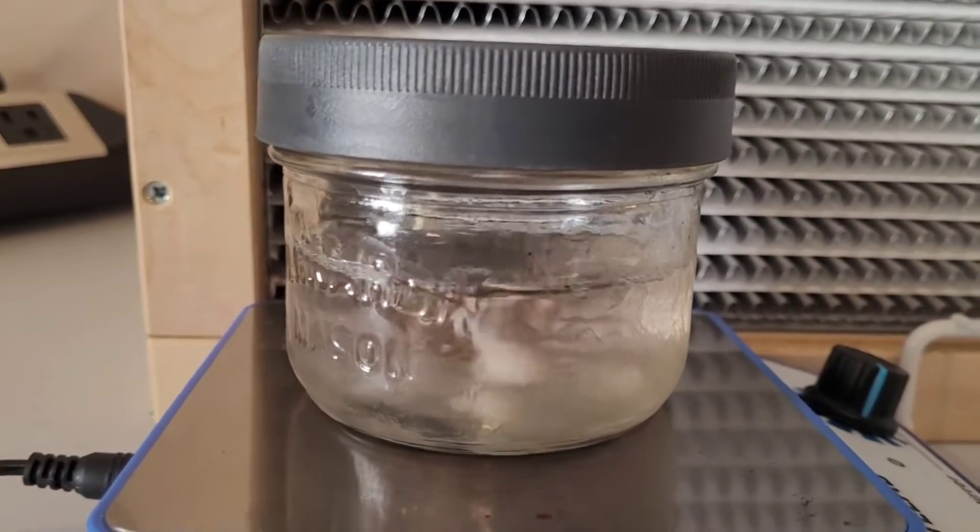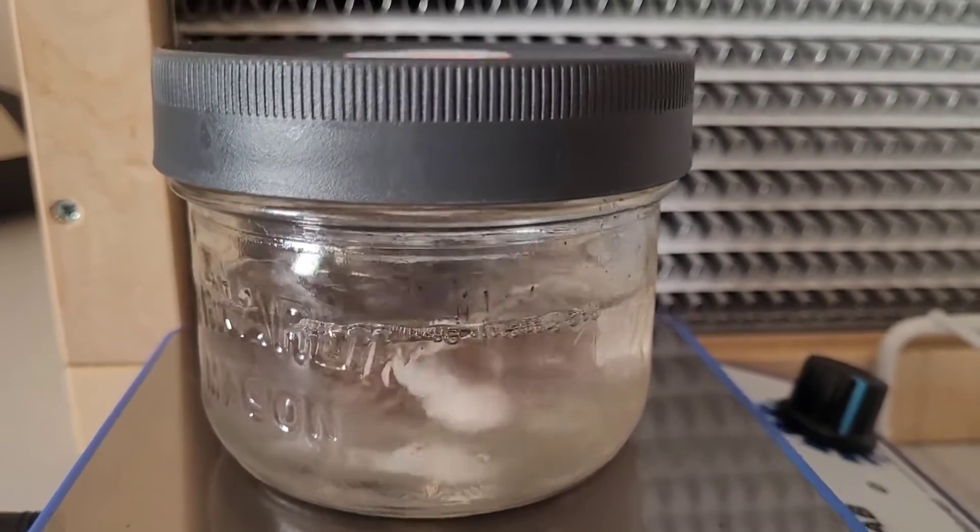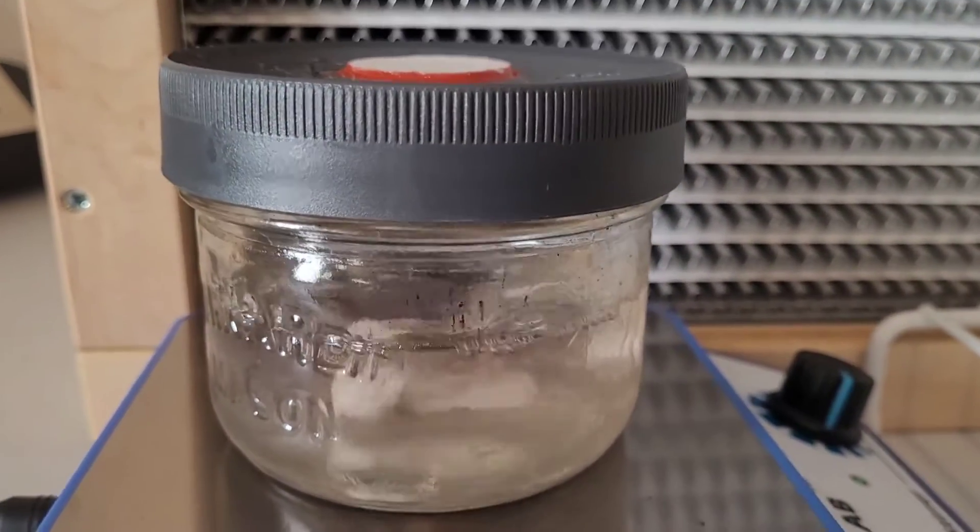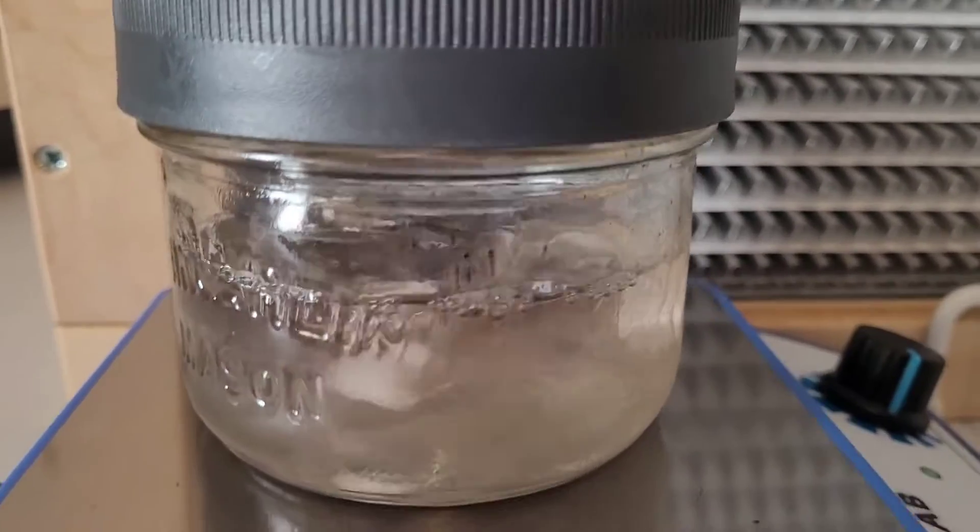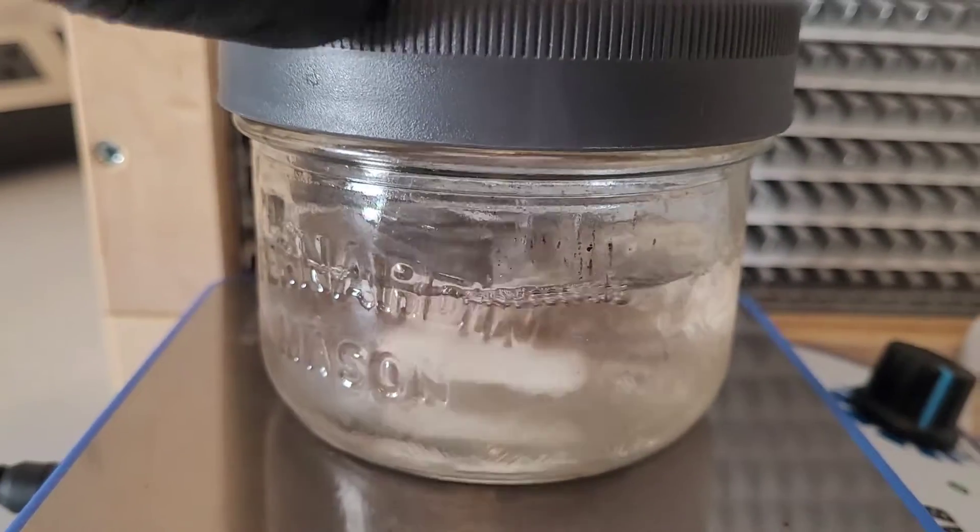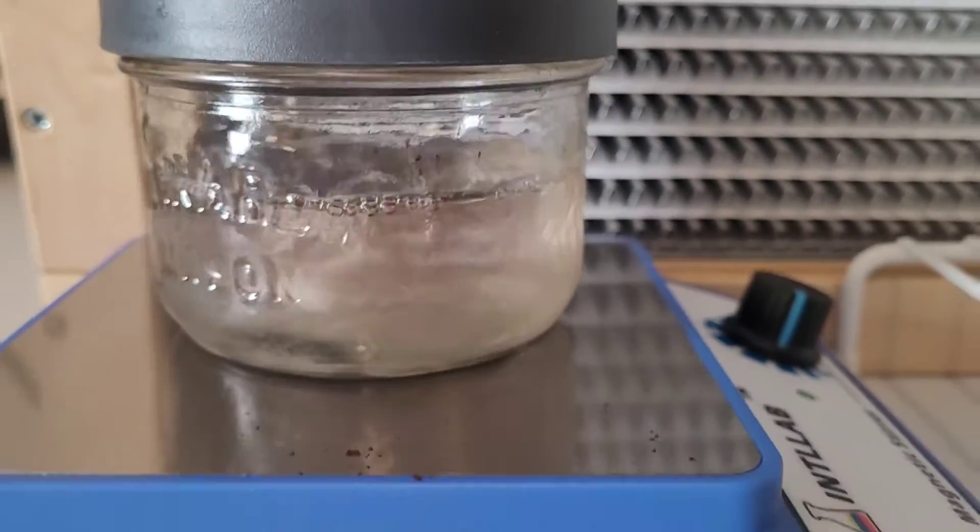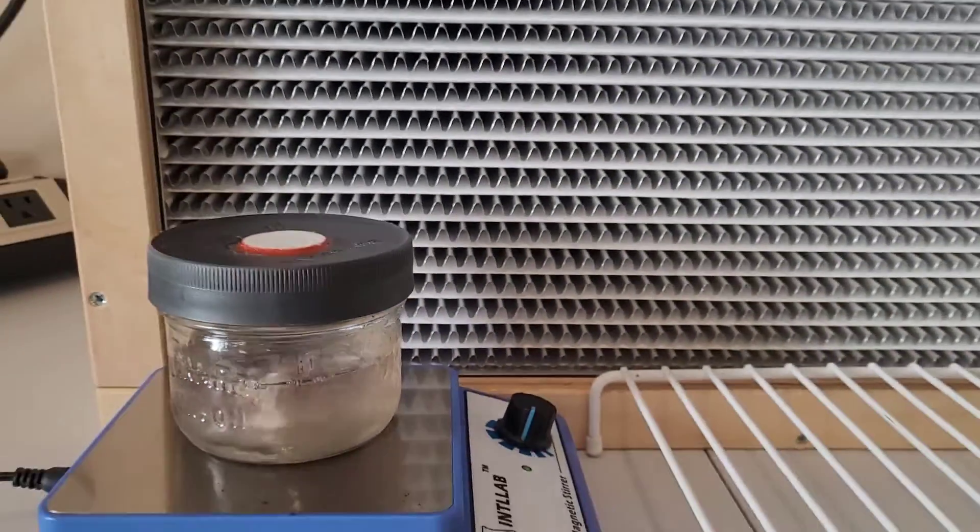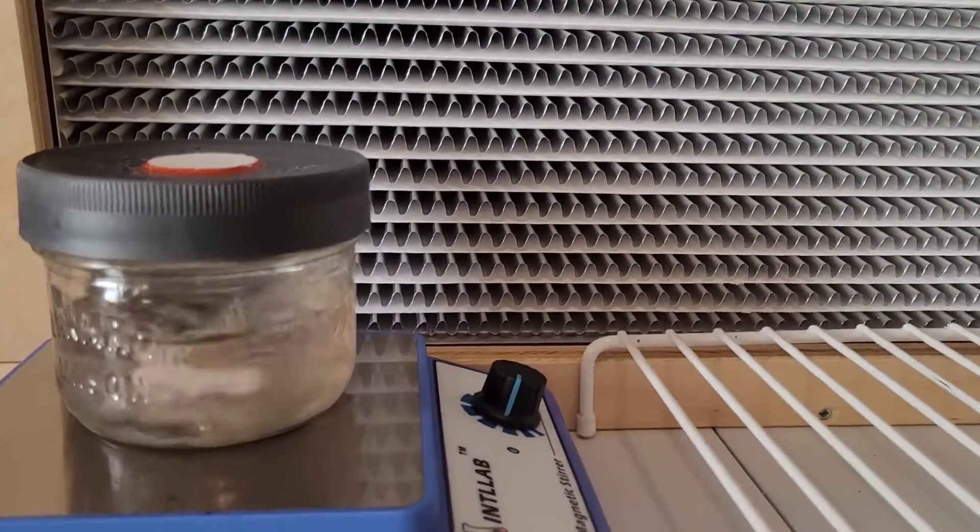And there you have it, spore-laden sterile water. Now there may be some contamination that was incorporated along with that spore print, but that's not much of a concern. That's what agar is for. So 24 hours and I'll be streaking this to some plates.